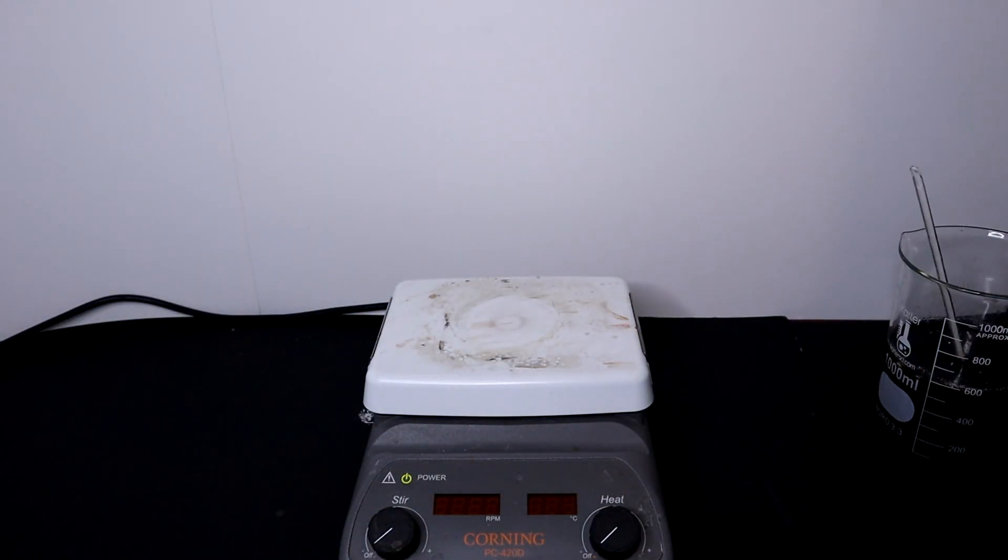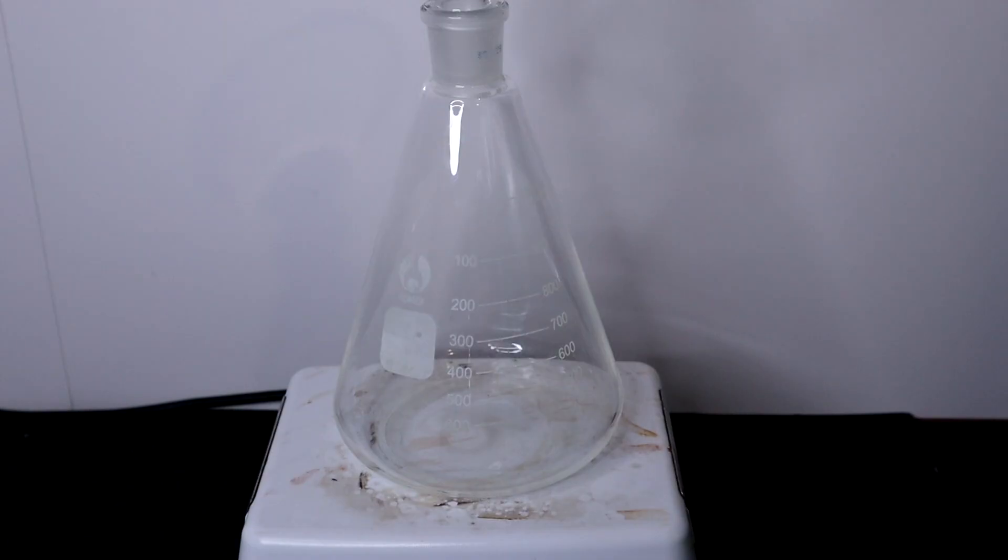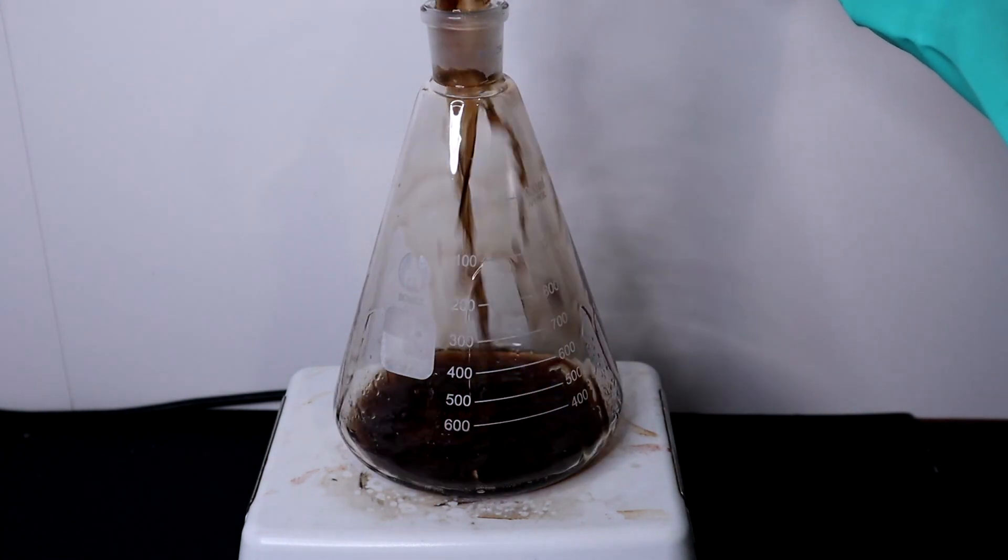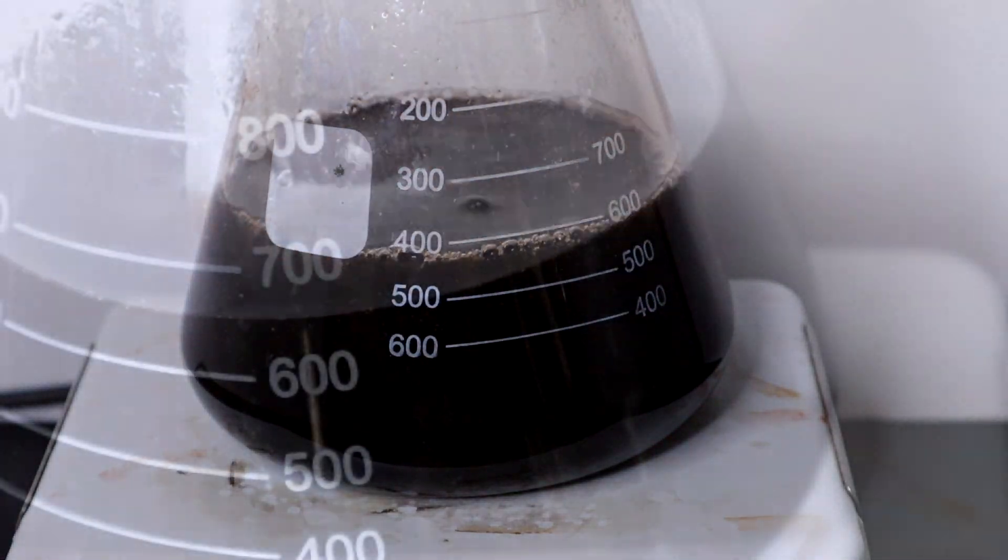After complete addition of the benzamide the solution was transferred to a 1 liter Erlenmeyer flask and heated with stirring for 20 minutes at 60 degrees.